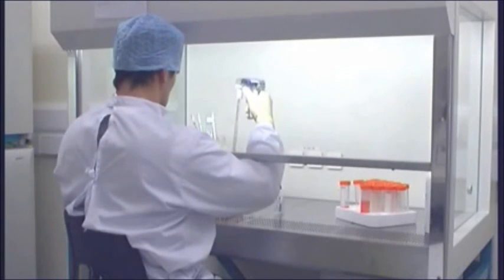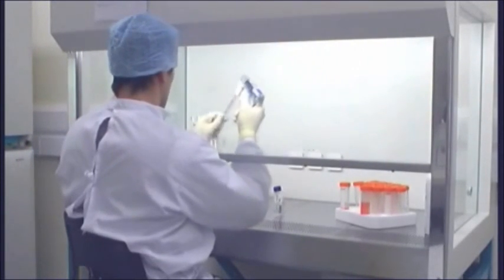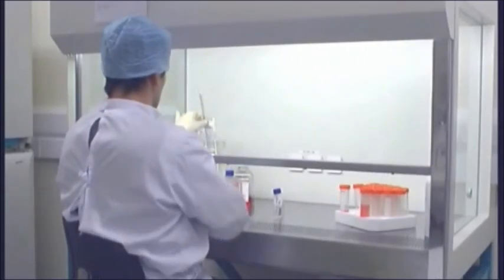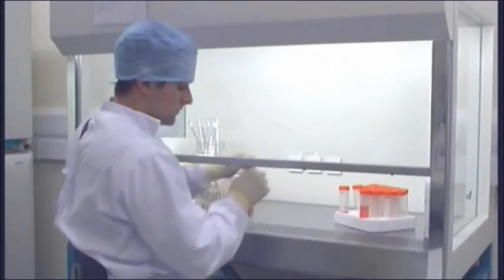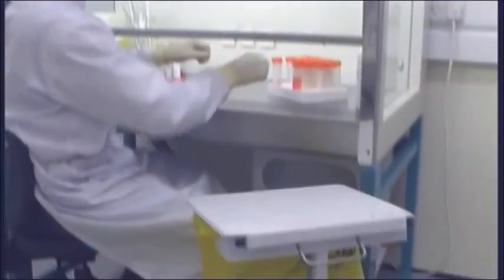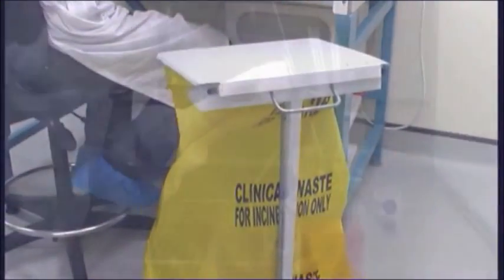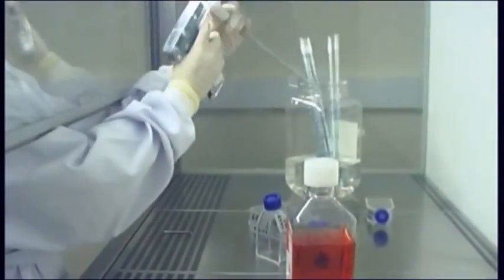Only essential items should be placed in the cabinet. It is also advisable to have spare gloves, masks and other required items nearby the safety cabinet. A clinical waste bin and waste pipette container should be adjacent to the cabinet.